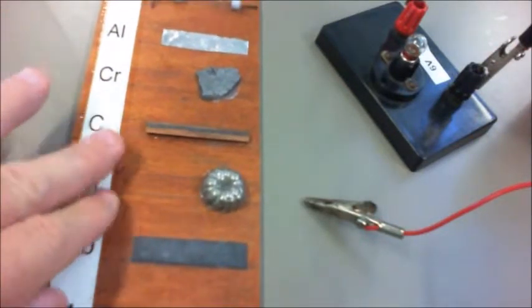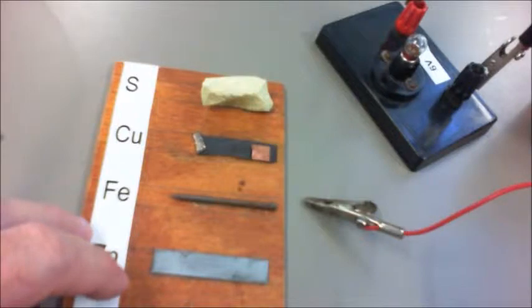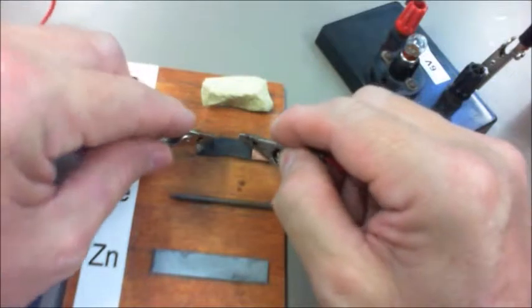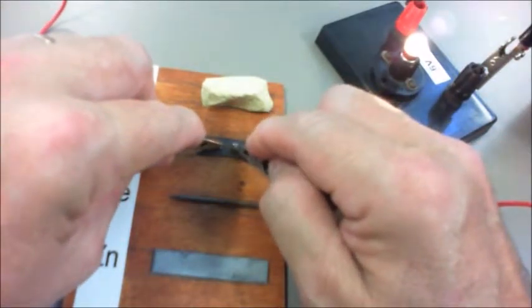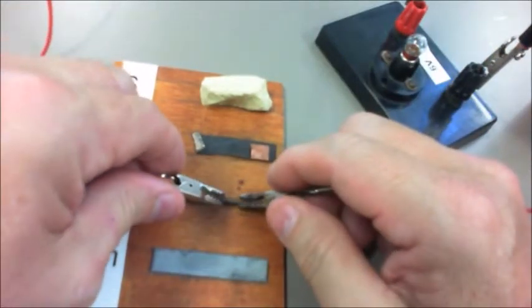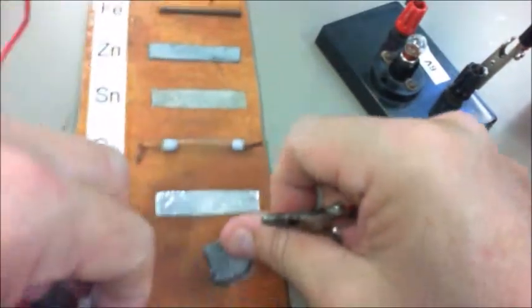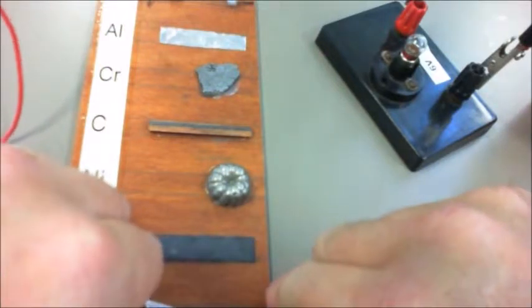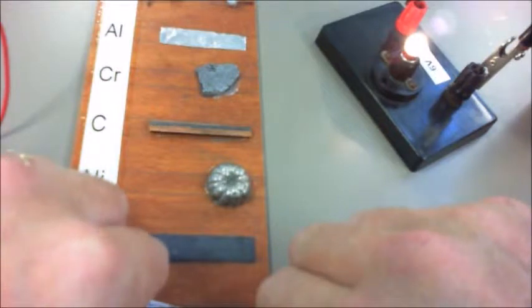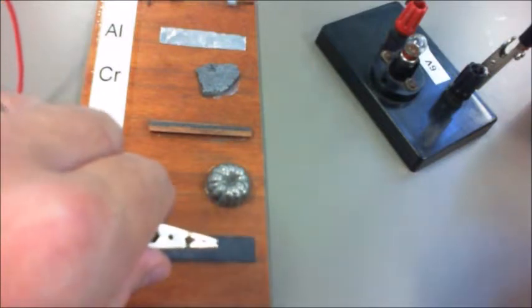Now our part B test is conductivity, so in other words, does it conduct electricity? As you can see, I have a light which is connected to a battery, and I'll place the two ends of the terminal onto the metal, and you can see that the light is illuminated, so that means that it does conduct electricity. We have a look at iron, and we find that the iron does the same thing as well. And then going all the way down to the magnesium, we've got a piece of magnesium there that we can use, and we can see that it also conducts electricity. So in effect, all of the three metals that we look at conduct electricity.